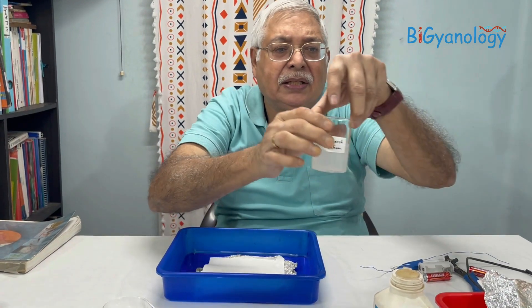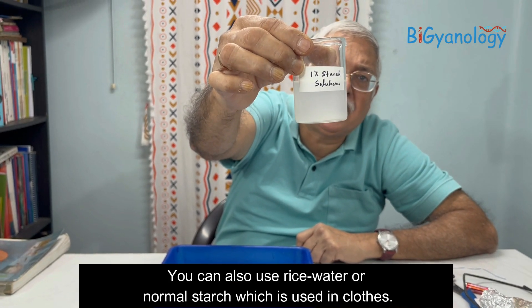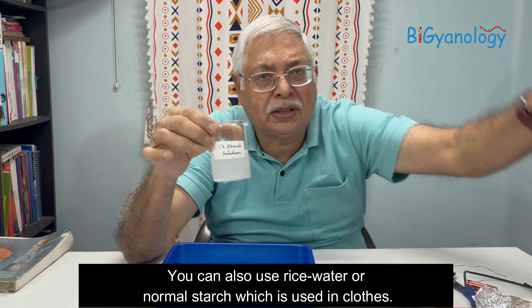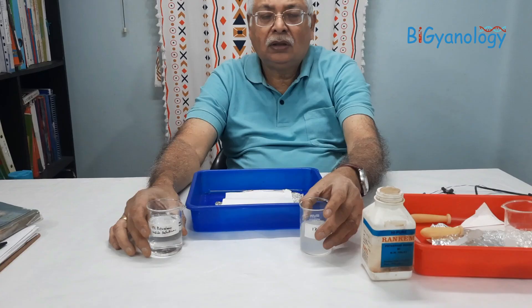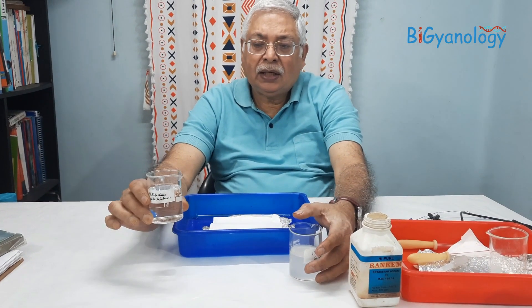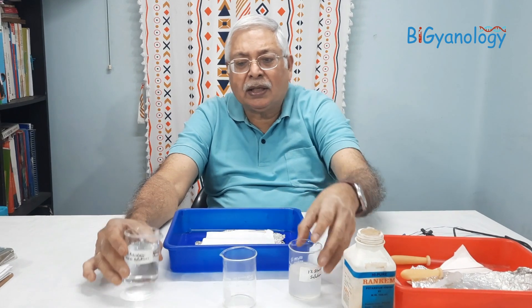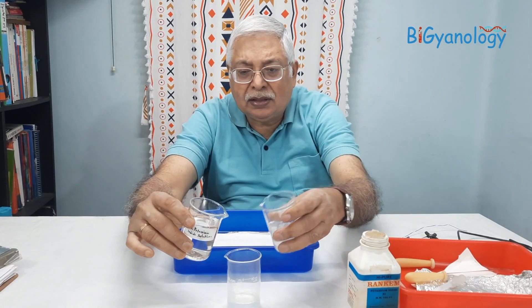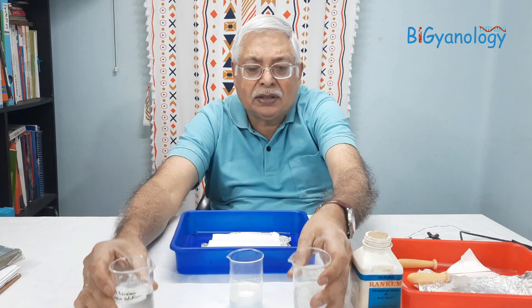We also have a starch solution — we took soluble starch and boiled it to make a solution. So we now have a potassium iodide solution and a starch solution. We are mixing these in a separate beaker, roughly one-to-one — more or less the same amount — using a dropper. This is the solution we need.